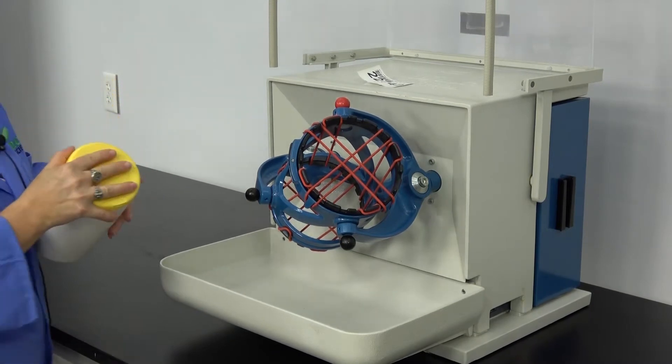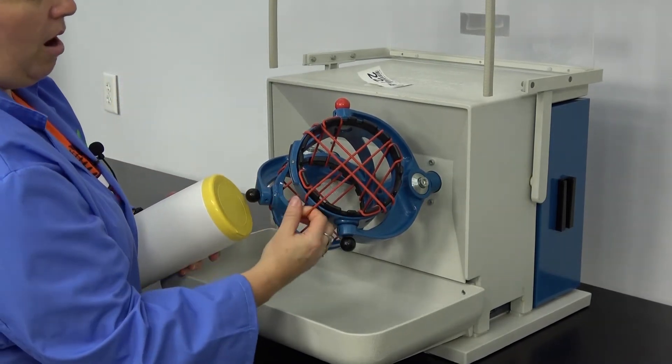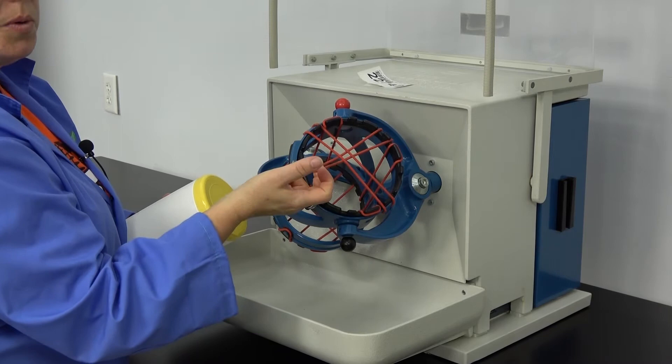You take your container. Our particular mixer is equipped with these red straps.